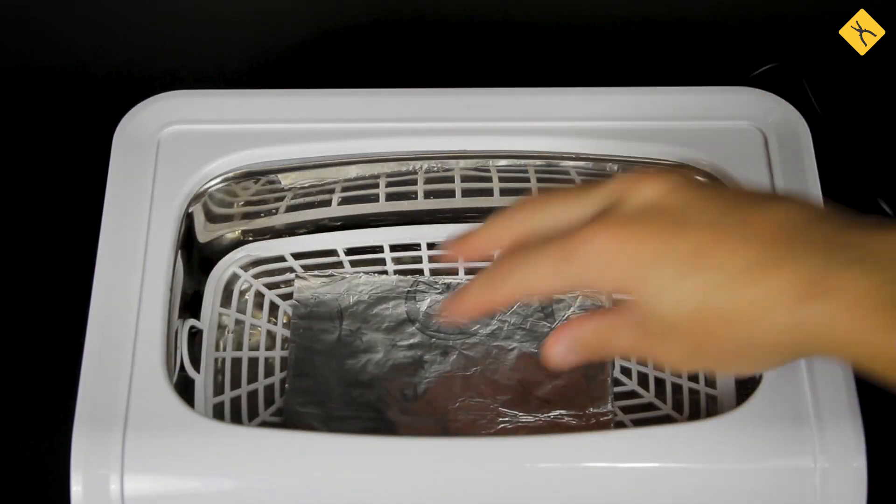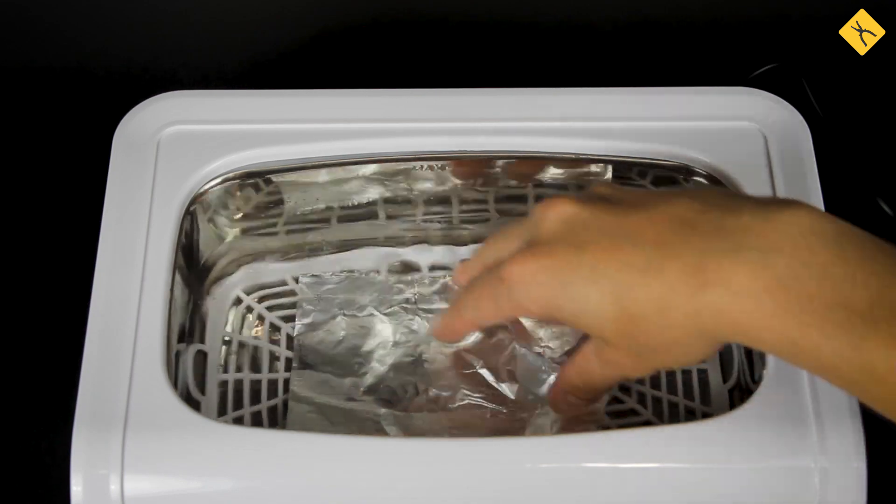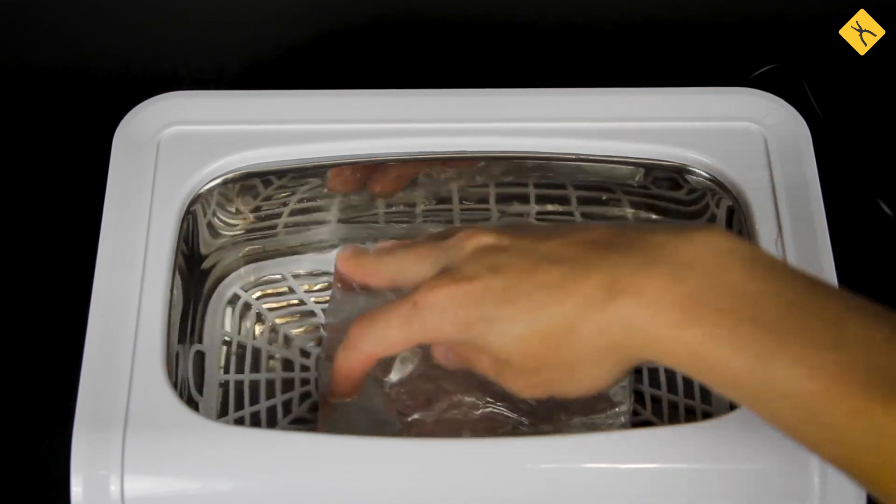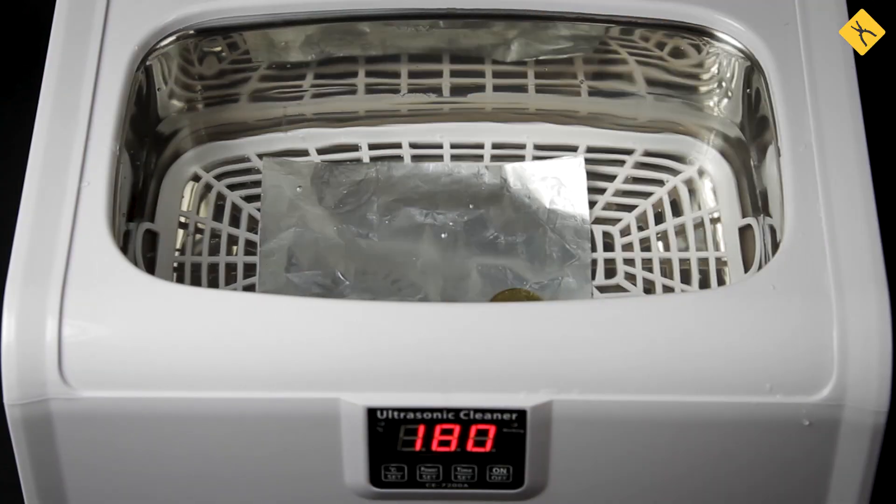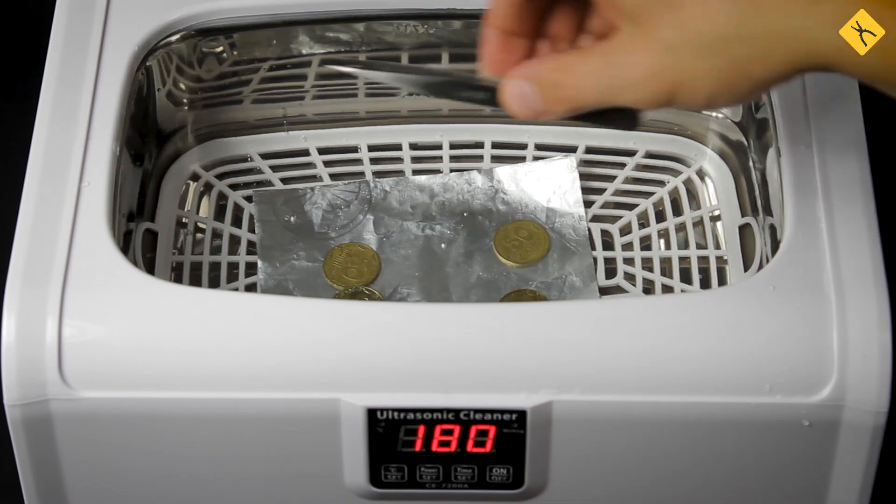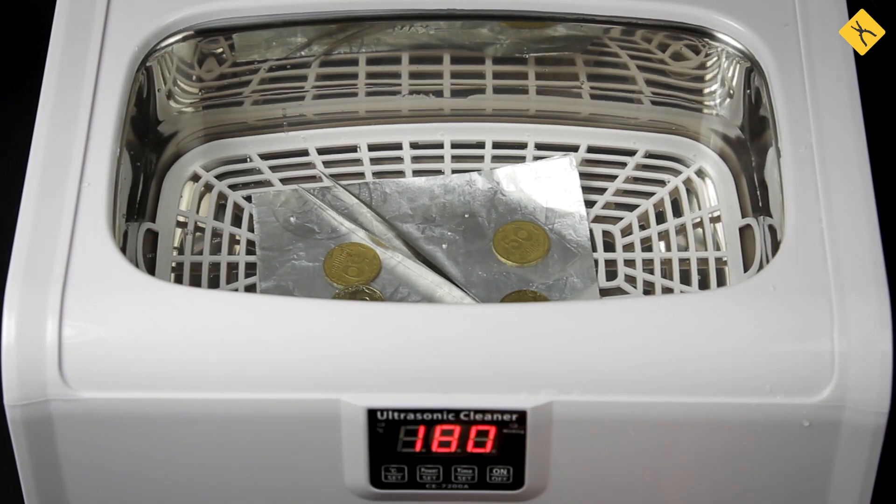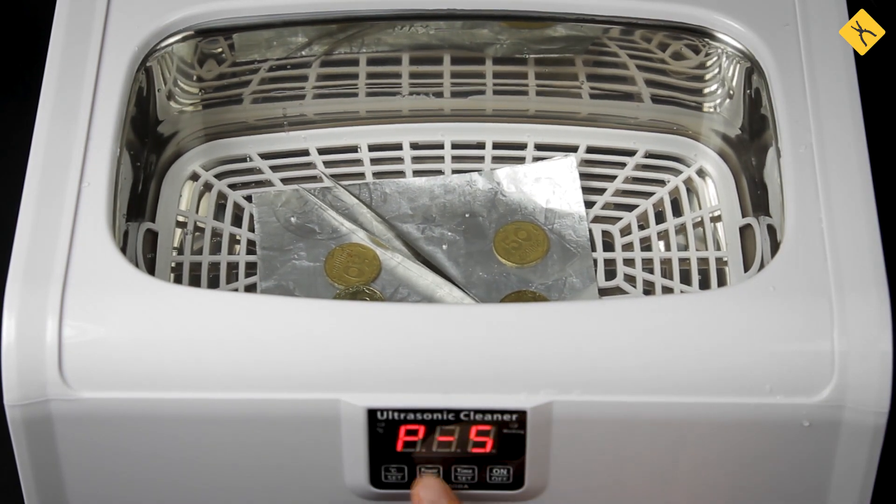Place the basket with the foil inside the tank. Switch on the device and watch the experiment.